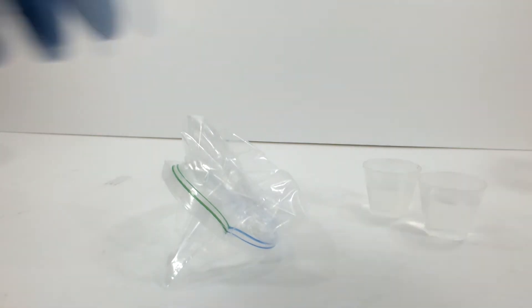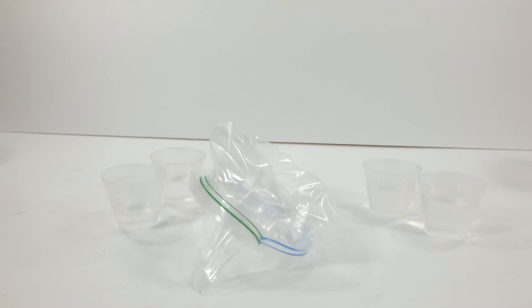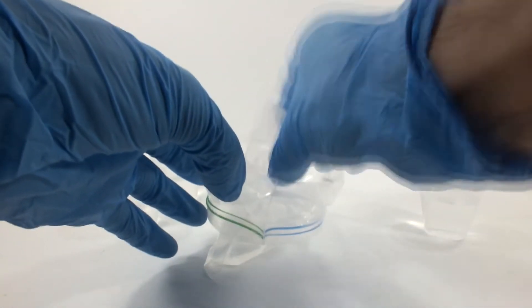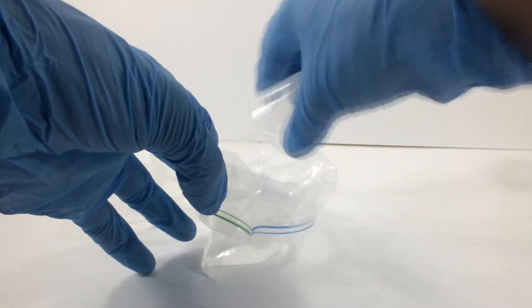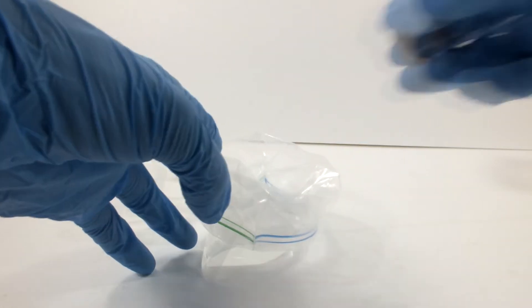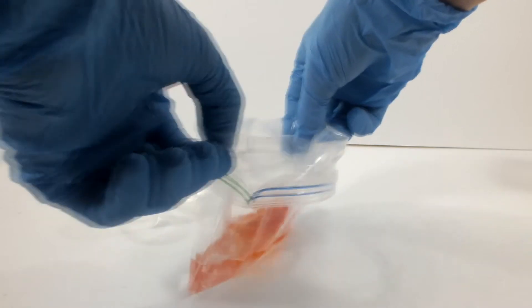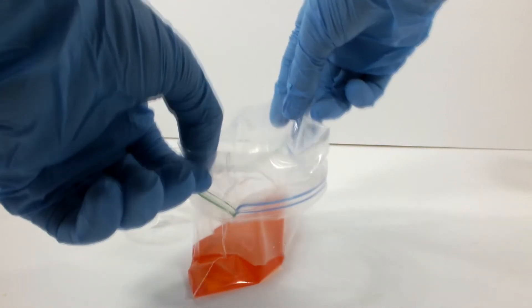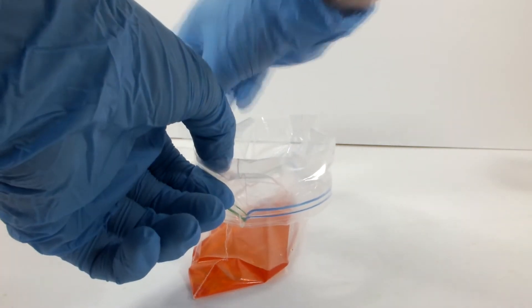Here's how I made it. On the right, there are 25 grams of sodium silicate and 25 milliliters of water. On the left, 18 milliliters of 95% ethanol and 7 milliliters of water. These are the proportions that were listed in the procedure I was working from. I also added food coloring to the silicate solution to make things a little easier to see.